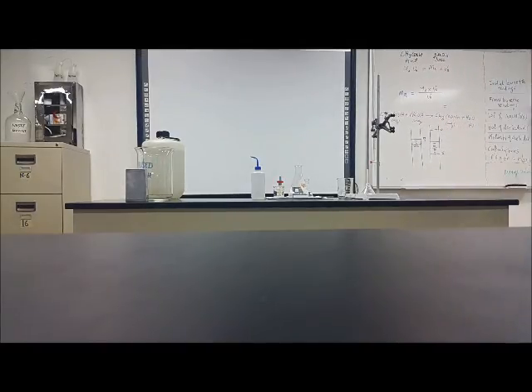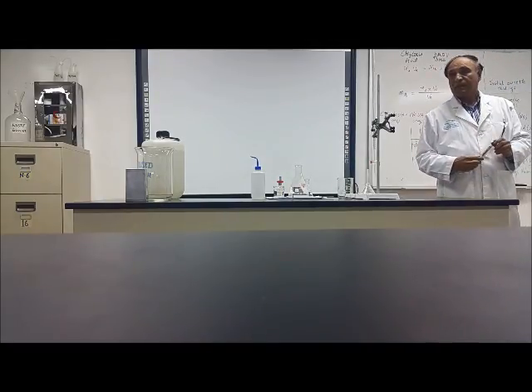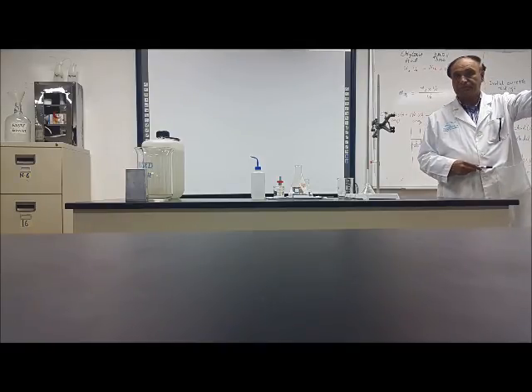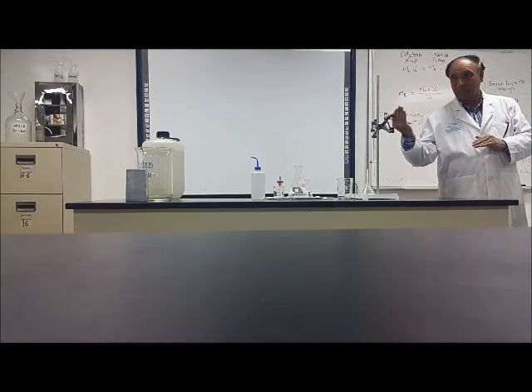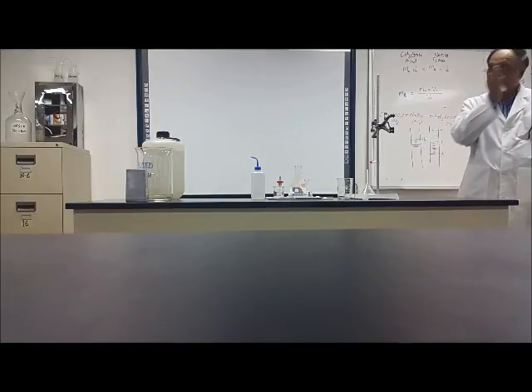You have here a small beaker, a funnel, a conical flask, a volumetric pipette and a burette. All these things, you can see, are very neat and clean. When you finish your experiment, the things should be like that. It should be all neat and clean. Who made it neat and clean? The previous group. And you will make it like that when you finish the experiment, for the coming group.